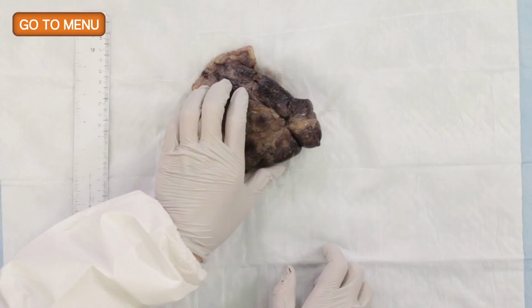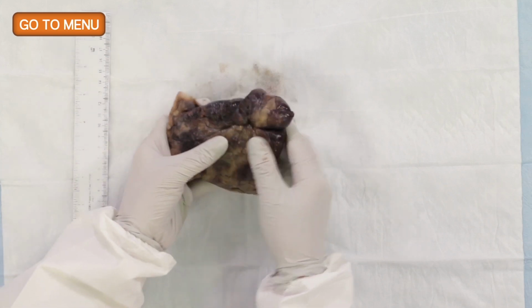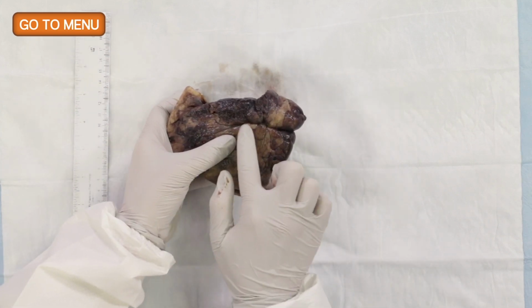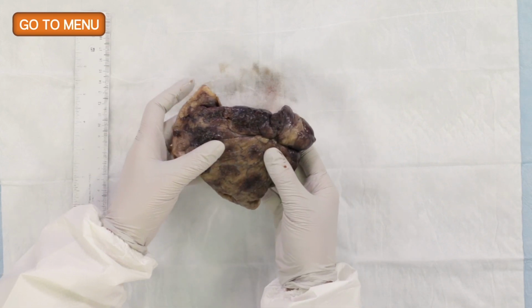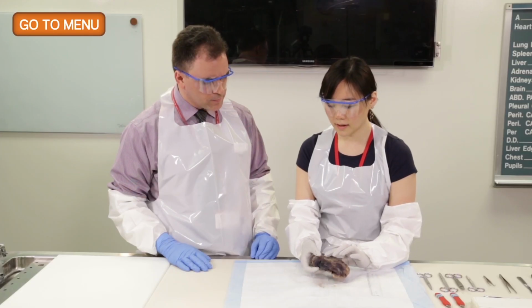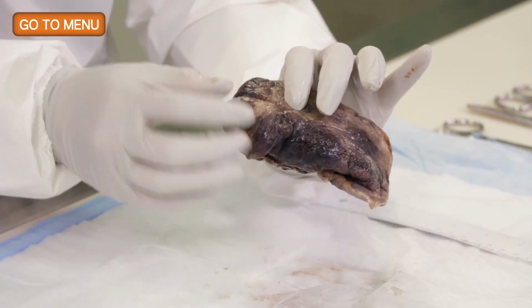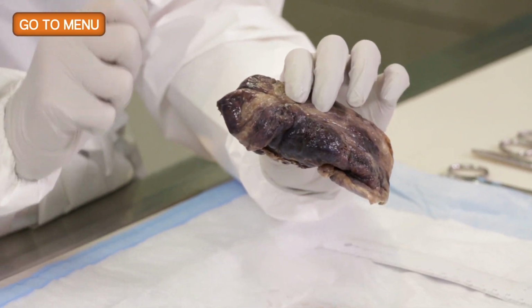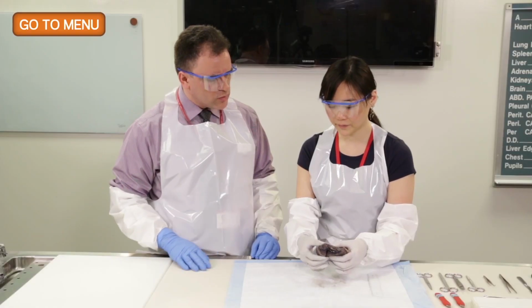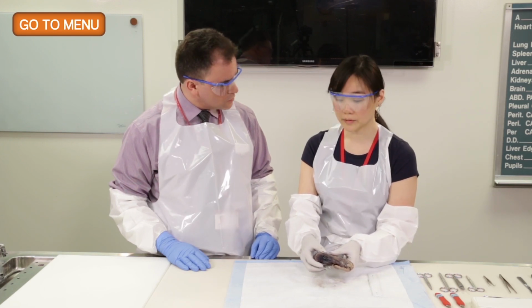Well, next I would also like to examine the entire pleural surface. And you can see over here, there is a pucker. And so what is the meaning of the pucker? What does that mean to you? For me, it means that there's definitely a mass underneath, and it's actually close to the pleura because it's pulling on the fibers. And why are we really interested in that area? It also changes the tumor staging if it involves the pleura.